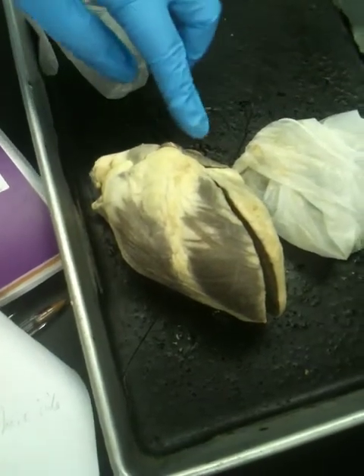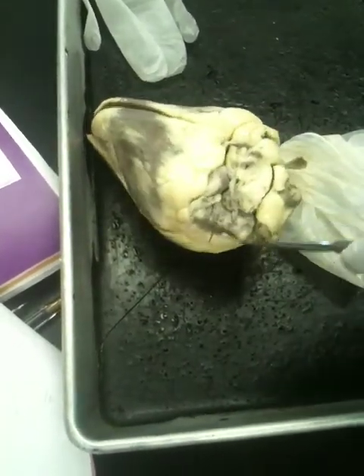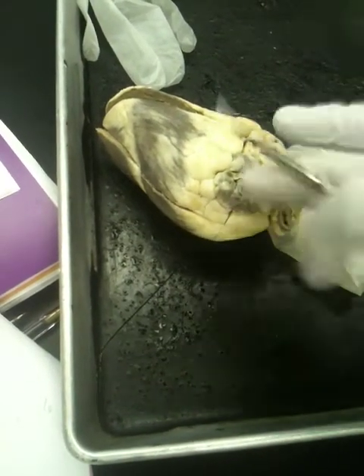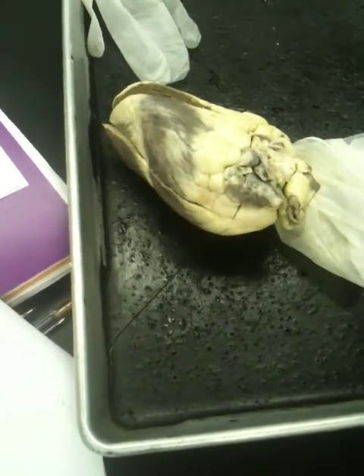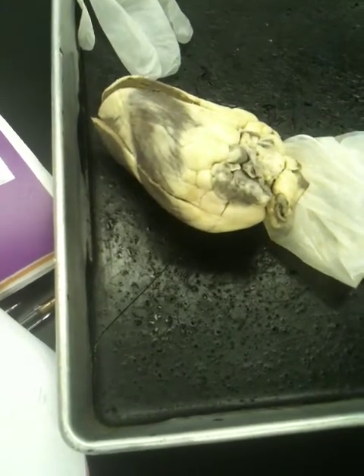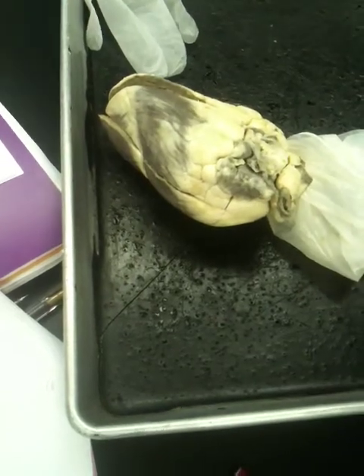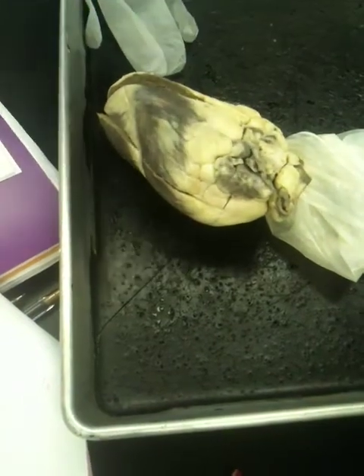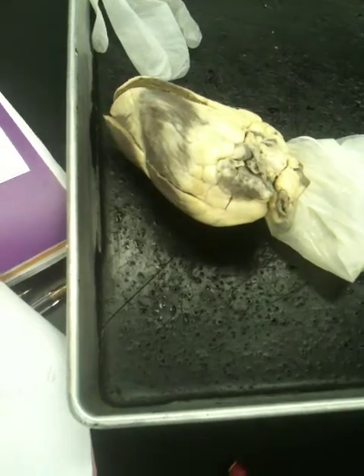So we see the auricle, it would be on the left side of the heart, right? Well, you can see that auricle. That's on the right-hand side of the heart. So I guess you need to know front from back. If you can figure out the front of the heart versus the back, then you can just use some Kentucky windage and figure out whether it's left or right. You'll do fine. I'm not a bit worried about that. This is the back, right? Correct. It is. Okay.